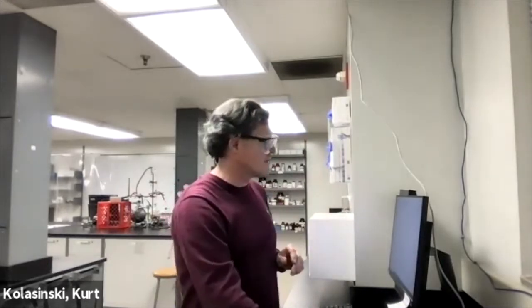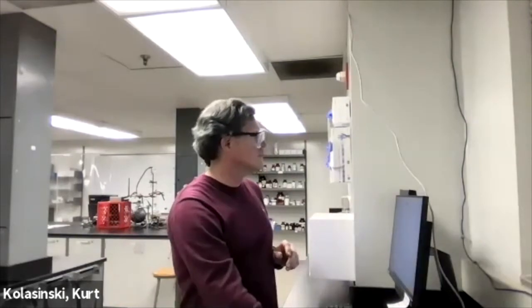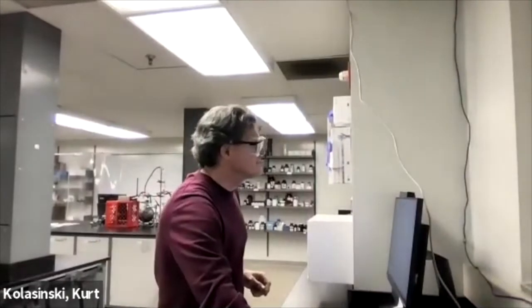Excite at 490. We're trying to figure out where we're going to get a fluorescence maximum. And so we have 1.5 nanometer slits, both excitation and emission. Not a whole lot of signal. How do we get more signal? Open up the slits. There we go. So we open up the slits.